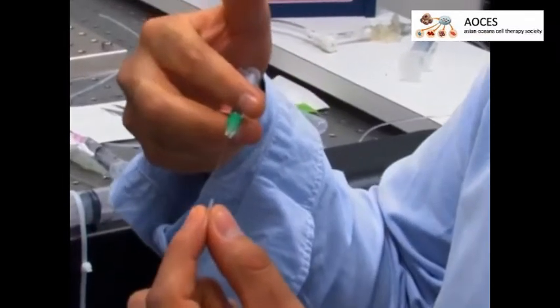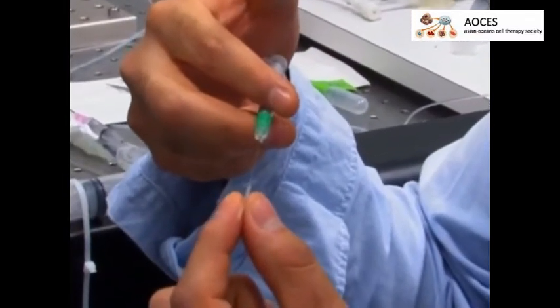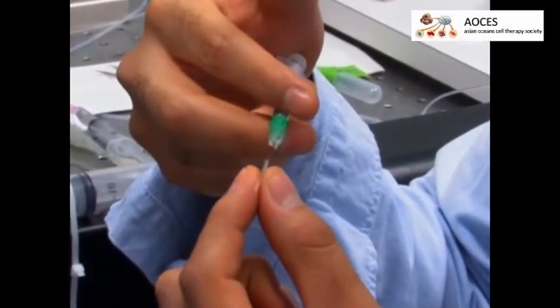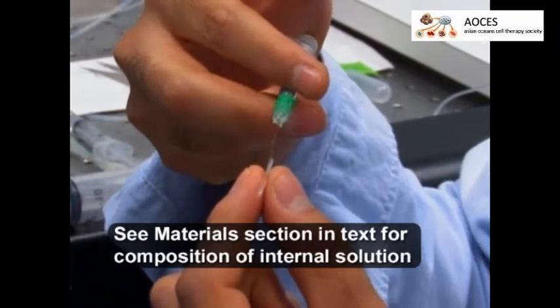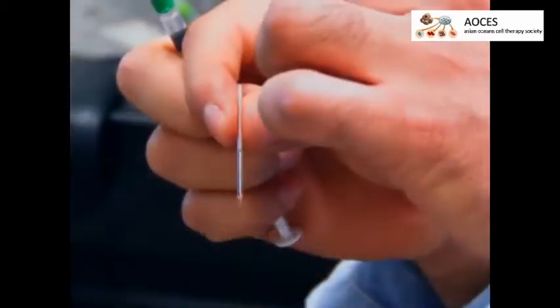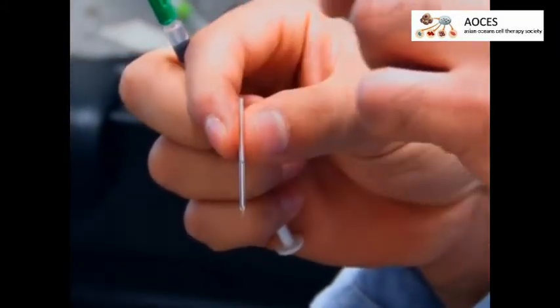In this step, using a 1 ml syringe, a non-metallic microsyringe needle, and a dedicated filter, fill a micropipette with the internal solution prepared in advance. Make sure there are no air bubbles in the micropipette.